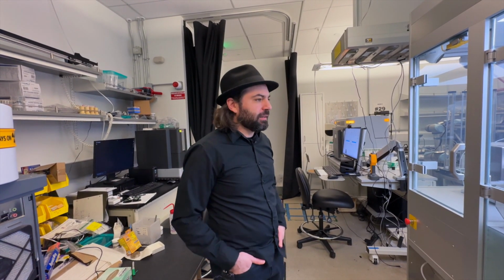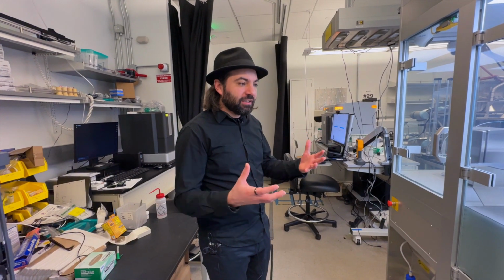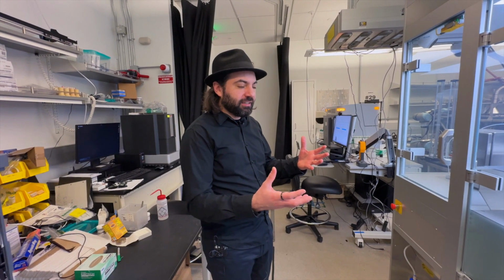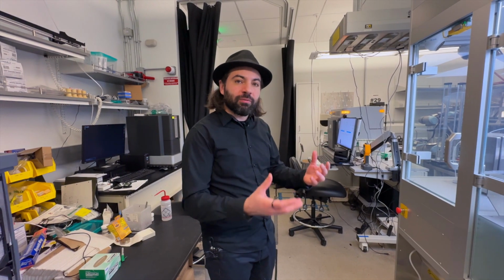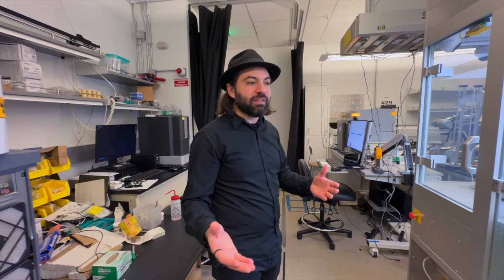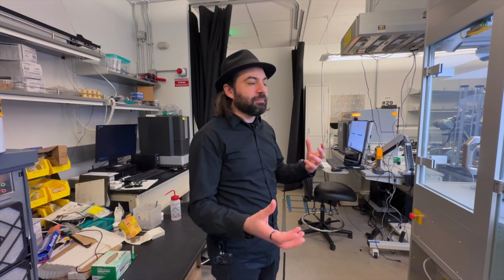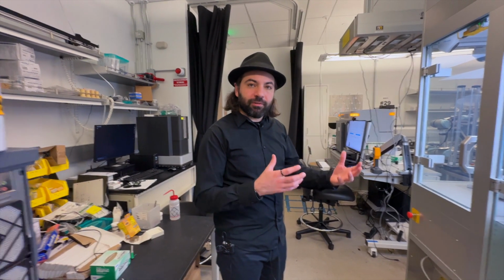And I think, like I mentioned before, some companies are trying to manage this need: we need the equipment to work and do the job, but we need to go beyond that. I think the standard very soon will be on all the equipment having at least some automation level.